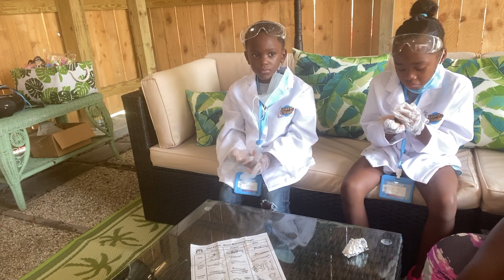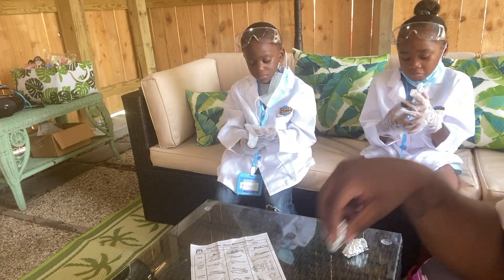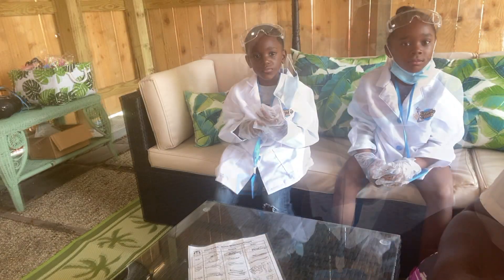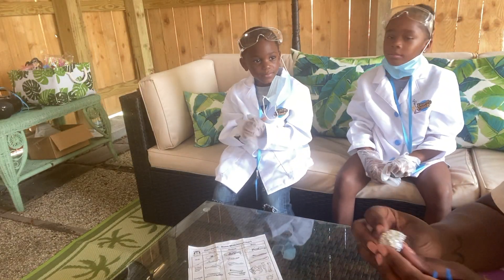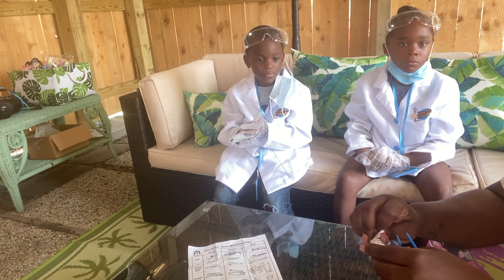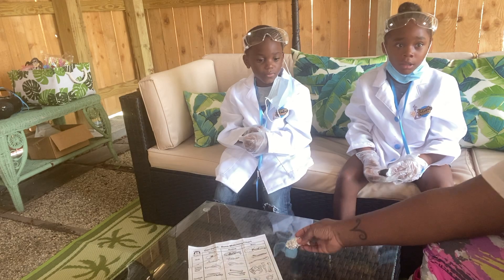So here's the pellet. Remember, after they eat it, it goes into the gizzard and then the gizzard makes them regurgitate it. Regurgitate means throw up. So here you go, Carmela — you open yours.